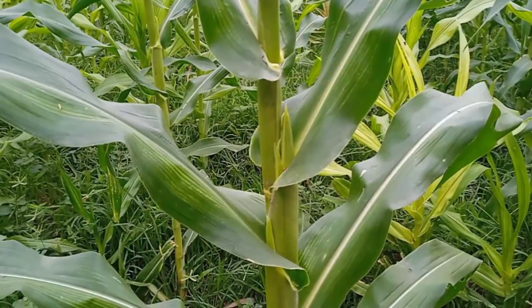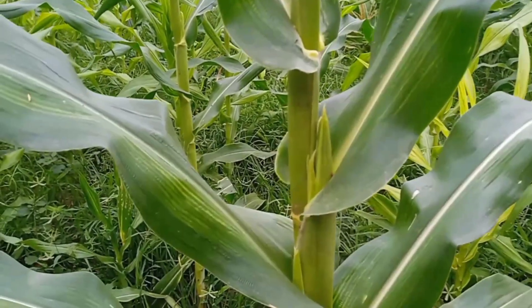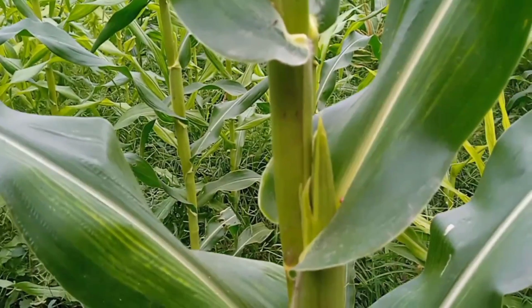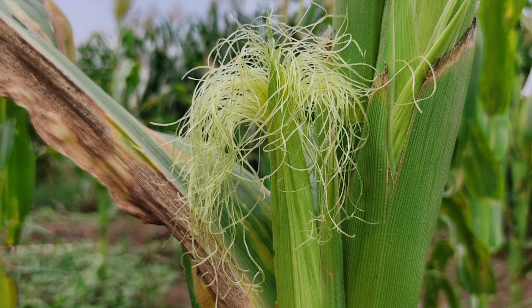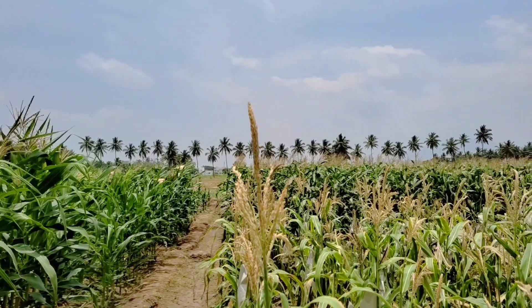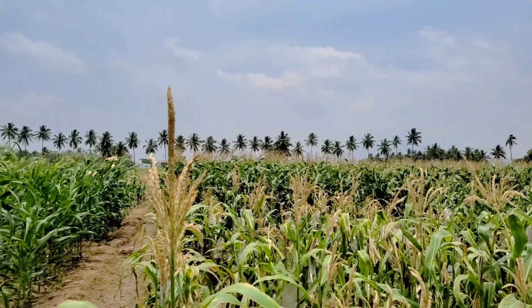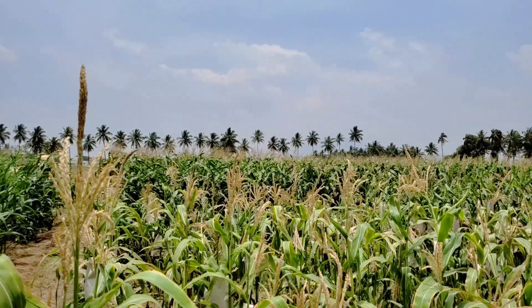There are two growth stages in corn: the vegetative stage and the reproductive stage. The stage in which silk has not yet emerged is followed by silking, where the silk emerges in two to three days — this is the R1 stage, where silks are visible outside the husks. We took corn cobs at 20, 25, and 28 days after pollination for the estimation of total soluble solids using a Brix refractometer.